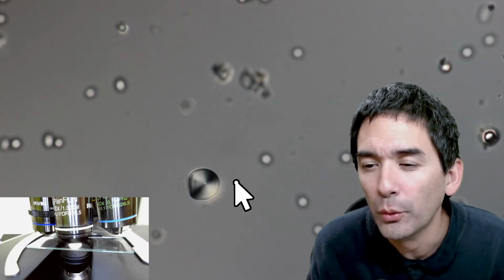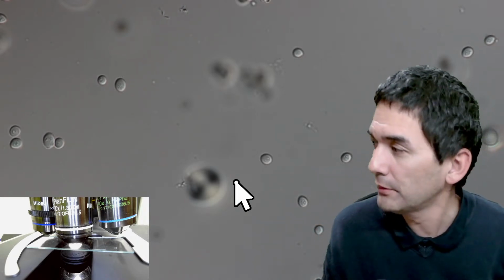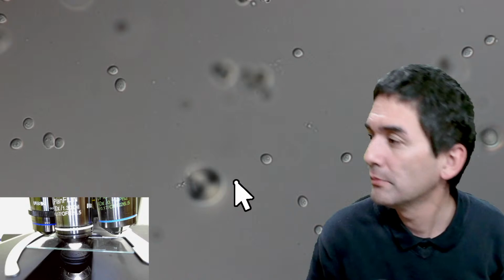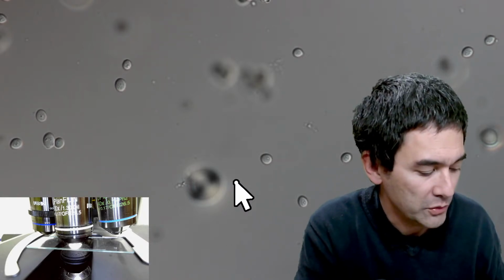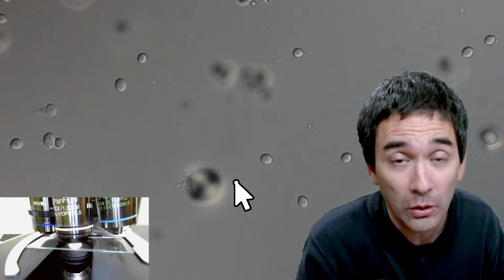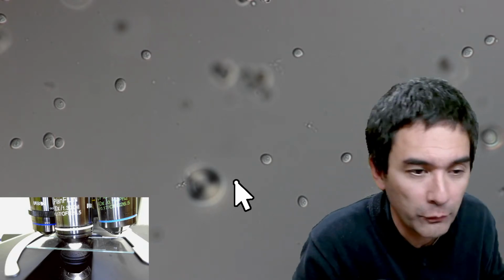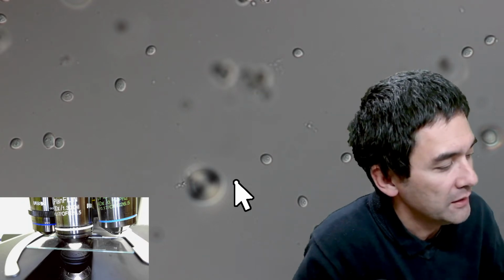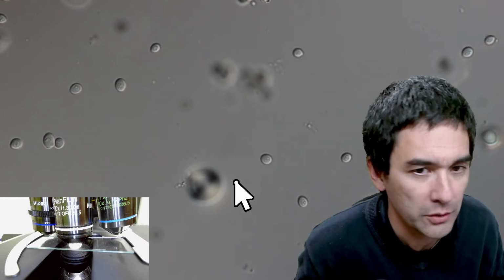Can you go over what the best way is to remove the oil after you're done? Yeah, I'll do this at the end. I use lens tissue paper. Where did I put it? Yeah, I got some lens tissue paper, which I prepared, over there. It's dedicated lens paper that I'm going to use to carefully wipe off the oil afterwards. It is not necessary to completely clean it with alcohol and so on. Some people who use this routinely only quickly wipe it off and say it's okay if there's a little bit of oil left on it. I still would clean it because if there's oil left on it, it might collect dust. So I do recommend that it's cleaned, but there's no point in overdoing it and using solvents to remove the oil. I think that's a little too much. But you get the idea.